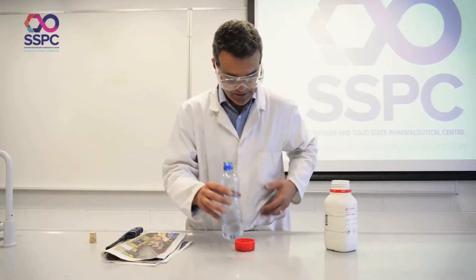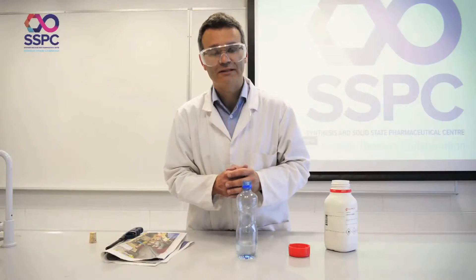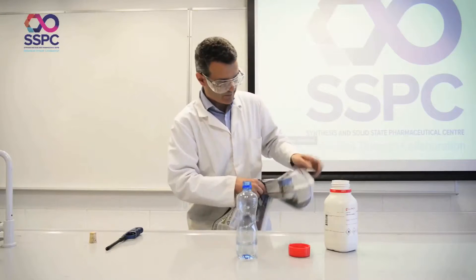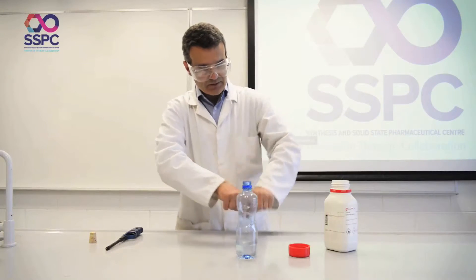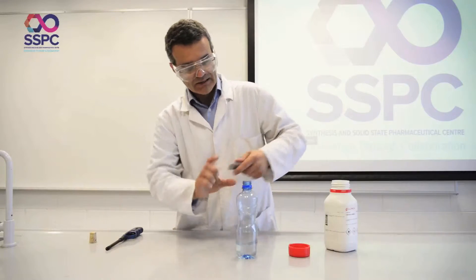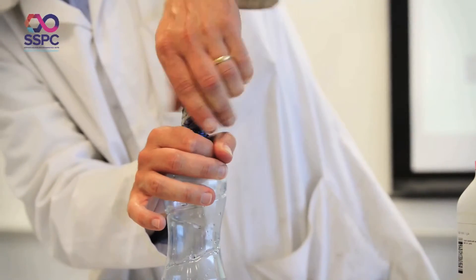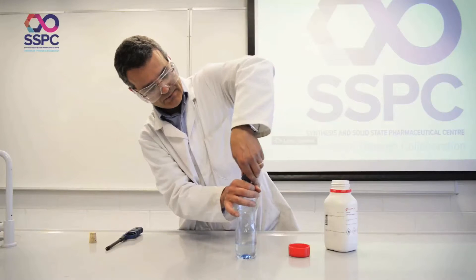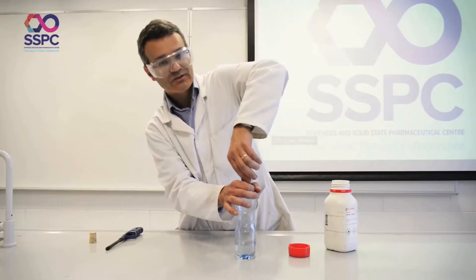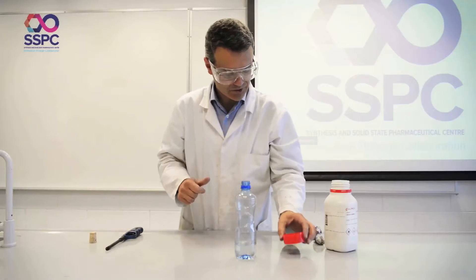You add in two or three little pellets of calcium carbide. Then you take a sheet of newspaper and scrunch it up into a wad so that it fits very tightly in the bottle neck. You want a good tight fit, and I'd have your wad of paper ready before you start the experiment — make sure it's a good snug fit and you can take it back out again. The snugger the fit, the better the experiment will go.